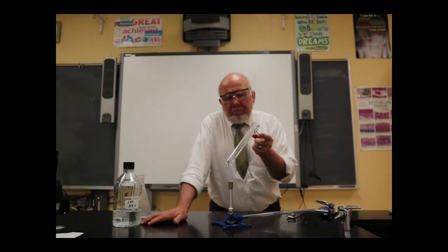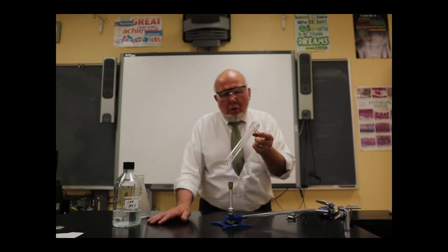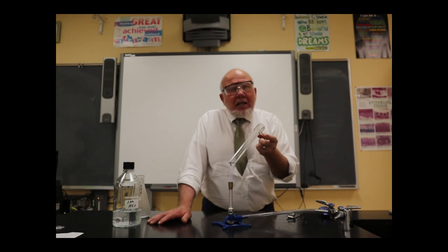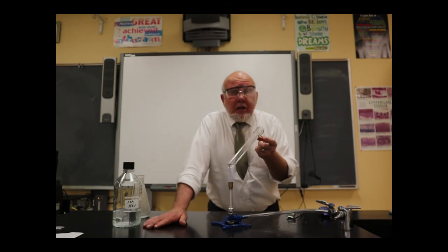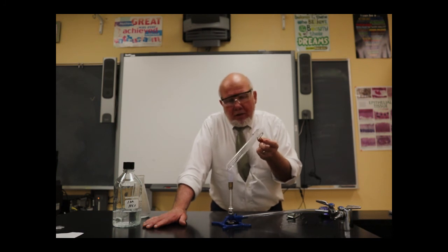All those bubbles that you saw, and the fact that I felt the test tube getting warm, heating up, that was showing you that there was a chemical reaction happening. We're forming something new. And it's not like salt dissolving in water. Salt is a white substance, right? And it dissolves in water, and you can't tell it's in the water until you boil off the water, then you see you have the white solid there.